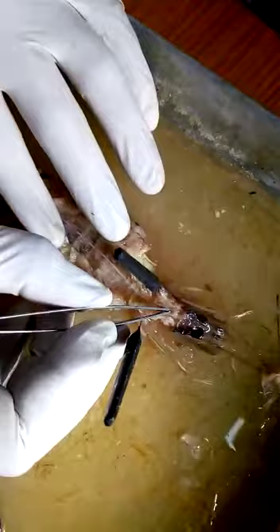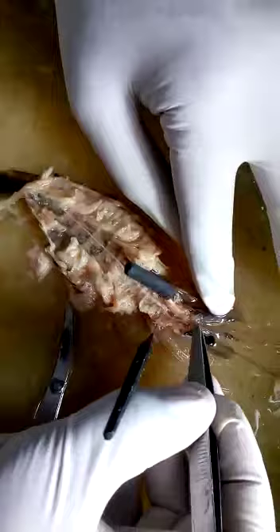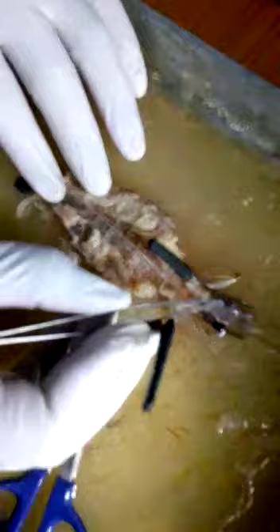The esophageal commissure ring is also present. Then the brain, then the optic nerve. The antennal nerve is also there — though that is not mandatory. The brain and optic nerve are mandatory. The esophageal commissure ring is also mandatory.